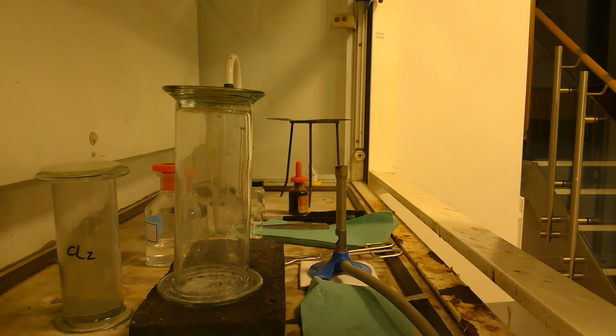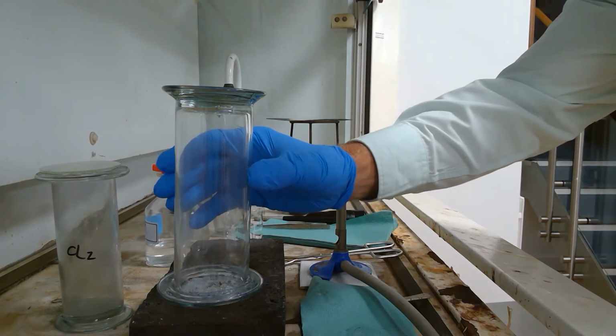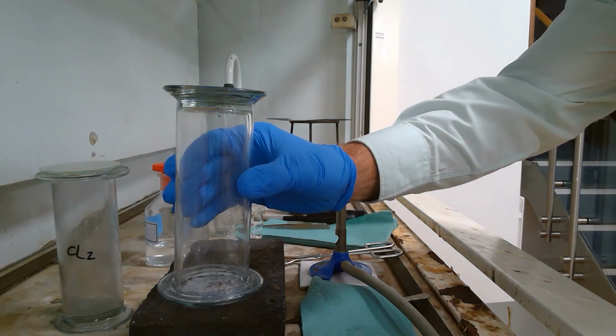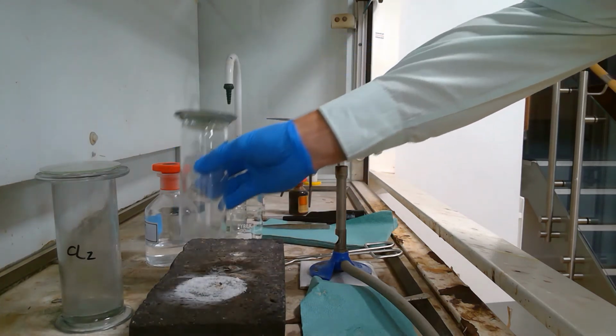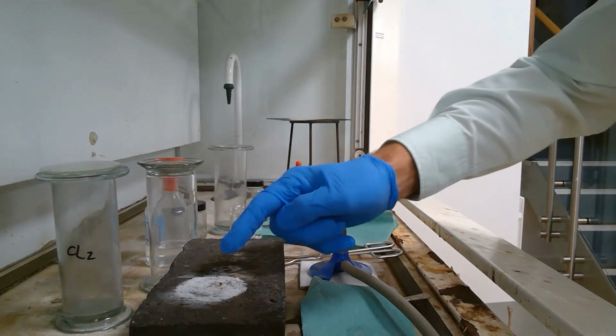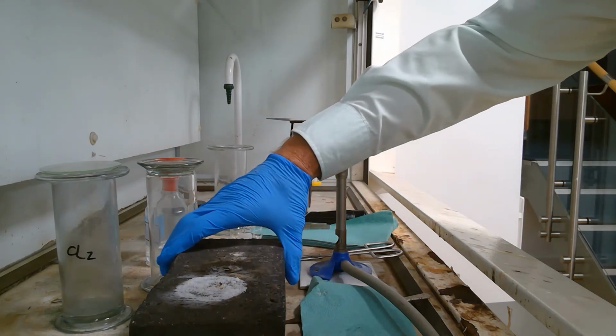Having left the experiment between the sodium and the chlorine for one day, all of the white smoke has dropped to the bottom of the container, and the sodium chloride has formed a white disc at the base. If I take the gas jar off now, all of the chlorine has gone, and it would be relatively safe to taste some of the white solid, which would then be sodium chloride.